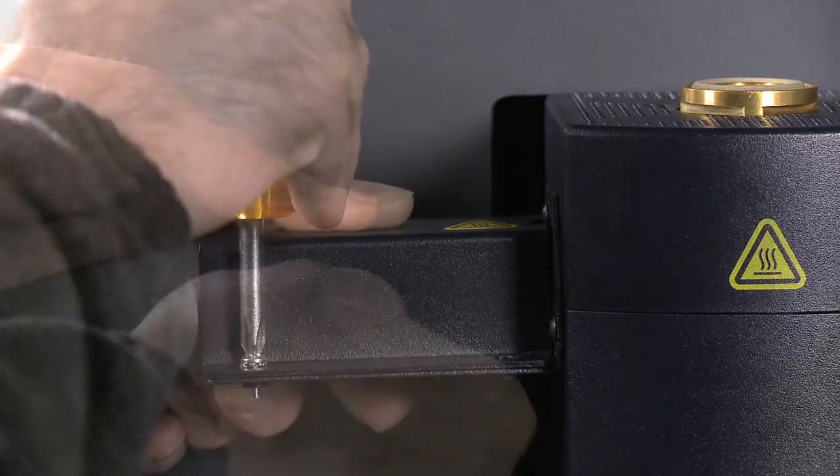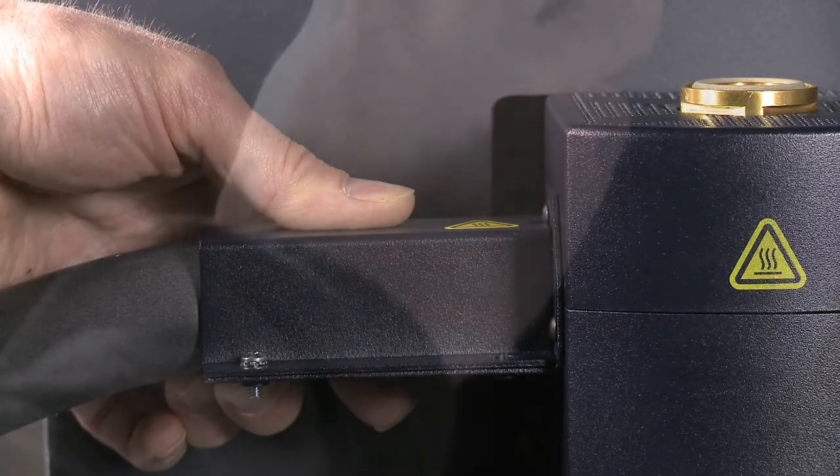Position the cover over the transfer line, and reinsert all four screws to hold the transfer line secure.